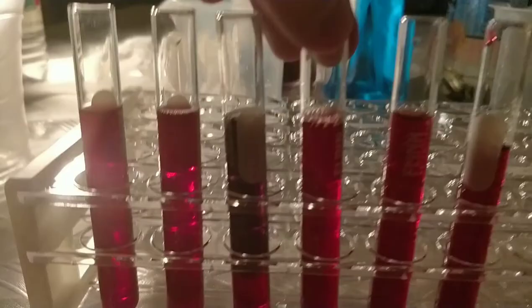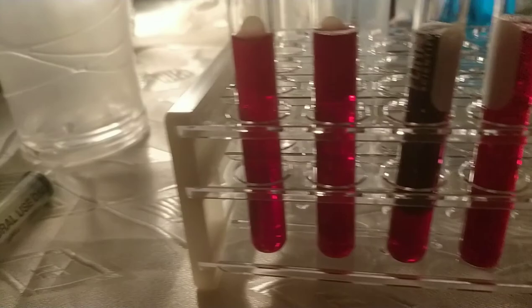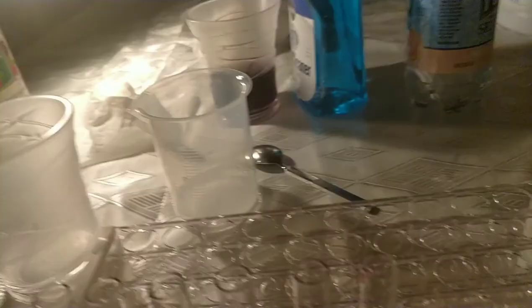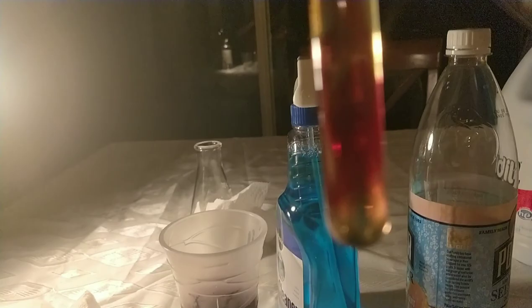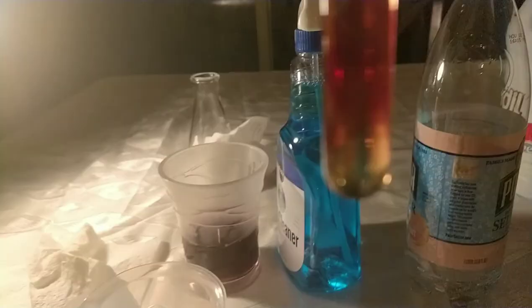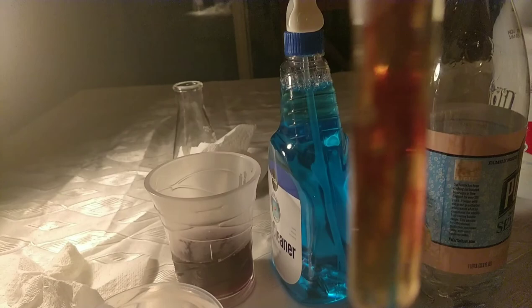Next I have the vinegar — adding it to this test tube. It hasn't changed the color much, basically the same color but much lighter than the purple. It remains purple. Next we'll do the bleach — which once again turned into the whitish-yellow. The bleach increased the density of the yellow grape juice and the purple is coming to the top, but overall it's yellowish-white.